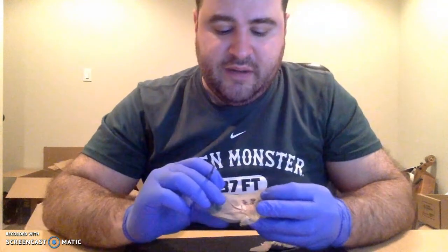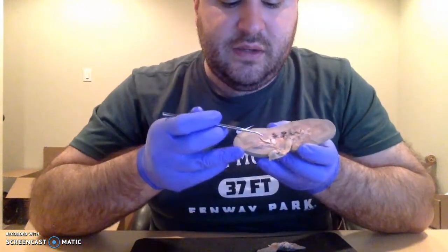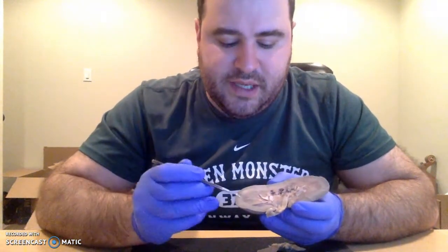They also contain nephrons. The renal pyramids all terminate into renal papillae that collect the urine, and eventually a lot of those come together.